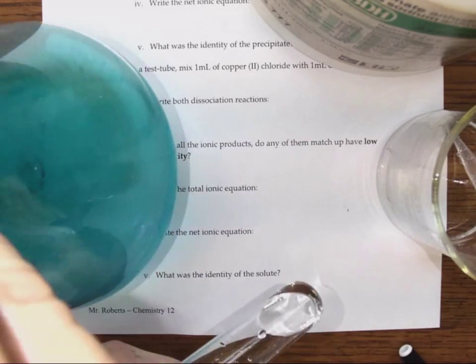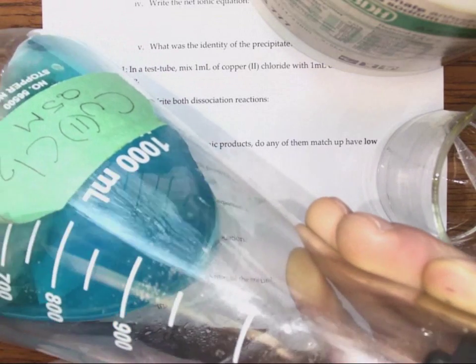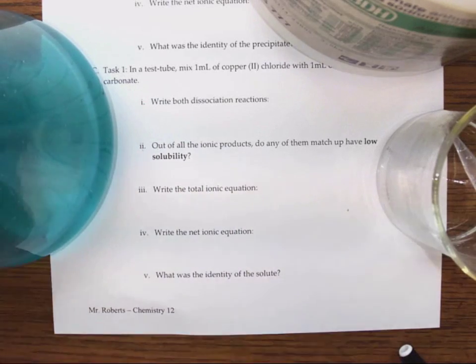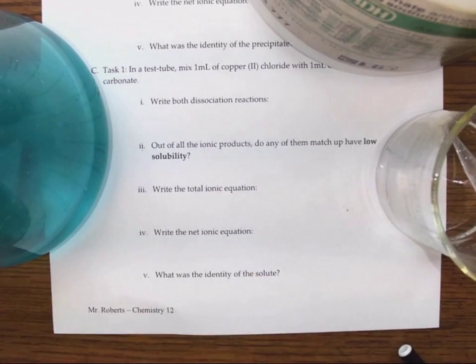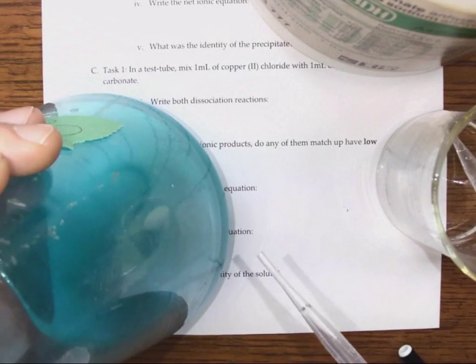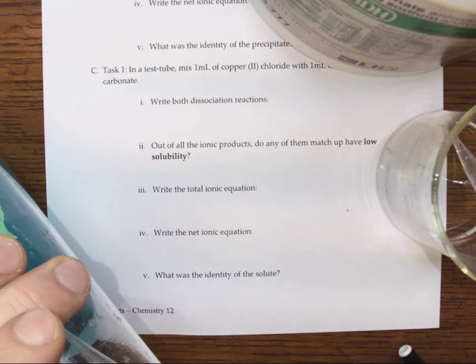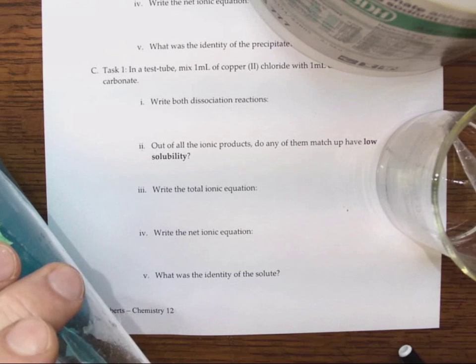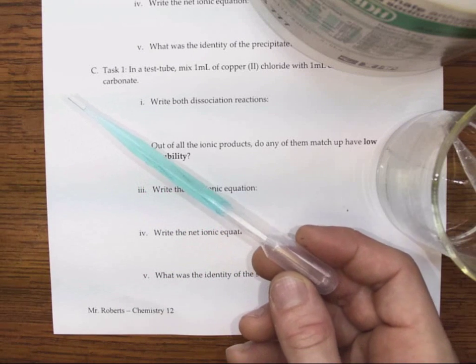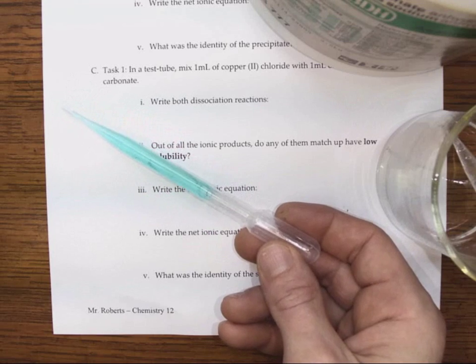And so here we have a solution. It has a color to it. It's sort of bluish. So it already has a color, but remember, it's not the color necessarily. Solutions can have colors. But what we're looking for is we can still see through it and read through it. It's a little hard to see through the video here. Also, there is something else going on with the solution we'll talk about a little later. So you can see that this is not opaque. You know, I can read through it. I can see the words a little bit there, reflecting through.